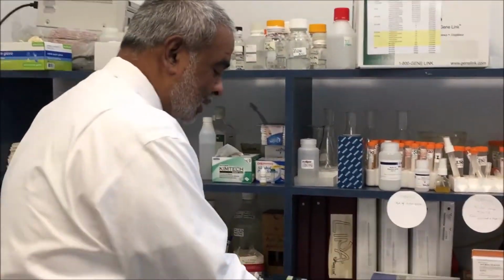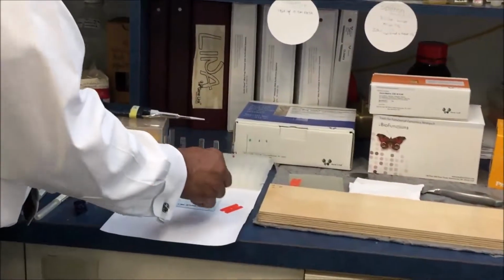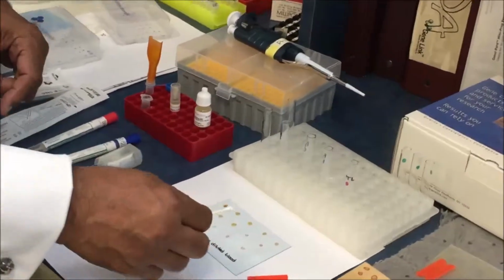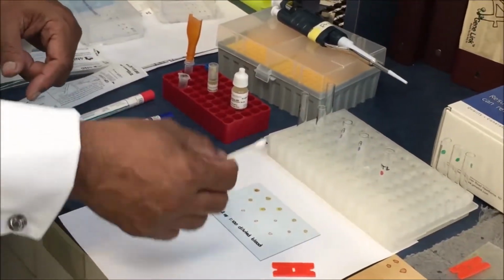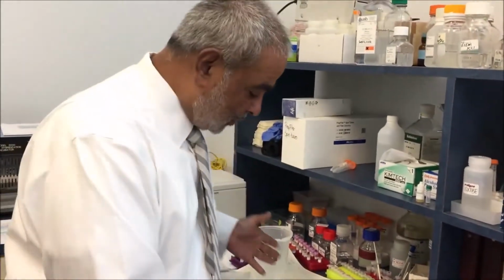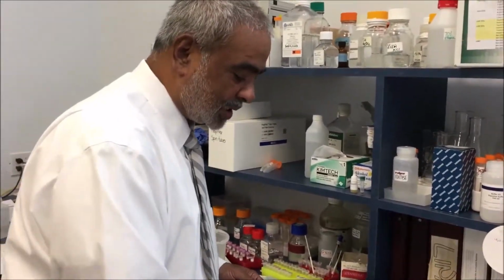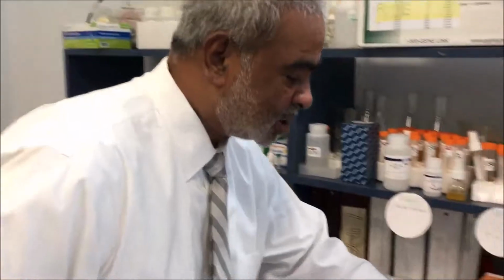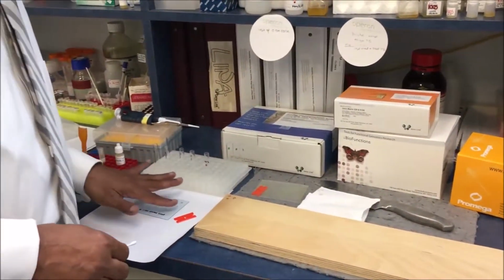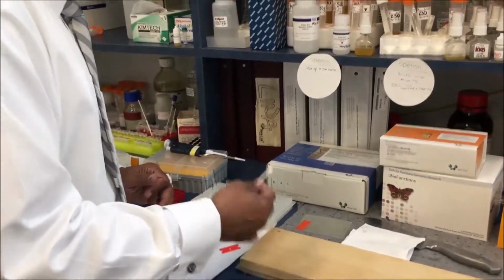If this is the sample that has to be collected, we will take a swab, moisten it in the sample area and then swab it. In session 3, we will show the sample collection method. So this is the classical method of using any of the different swabs to collect a deposited sample. Like the fingerprint I showed you in the previous session, on any non-porous surface, a swab is similarly used to collect the shed sample.